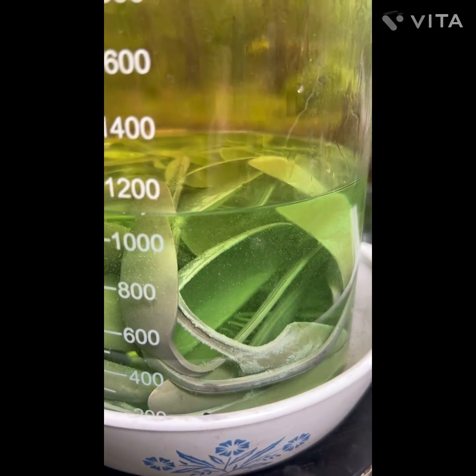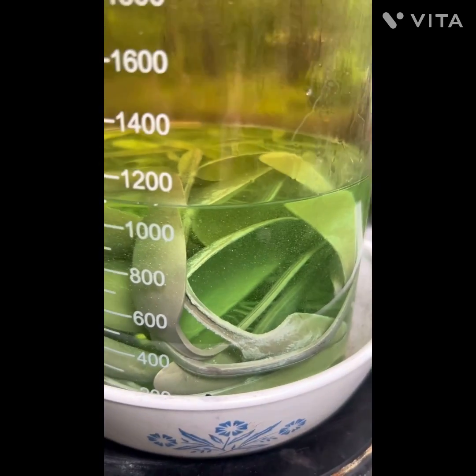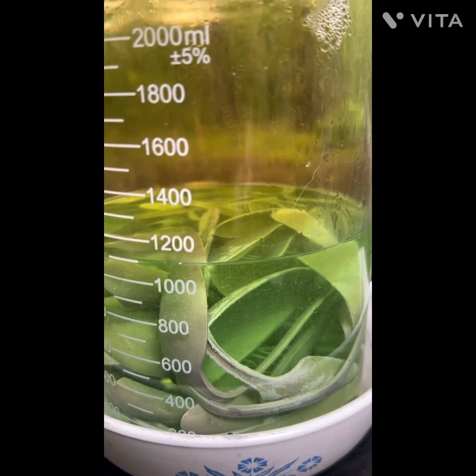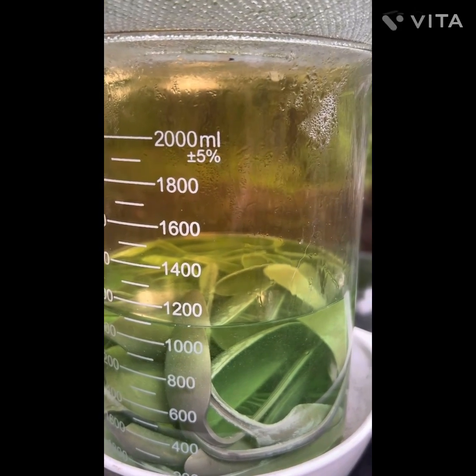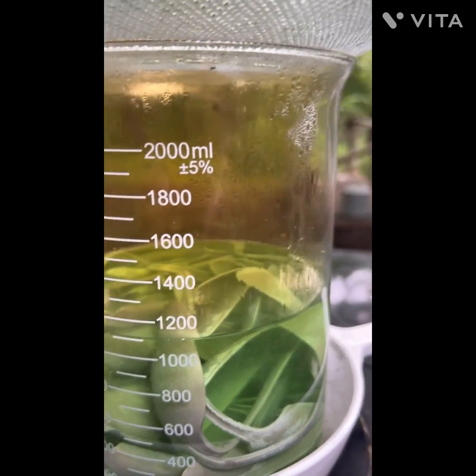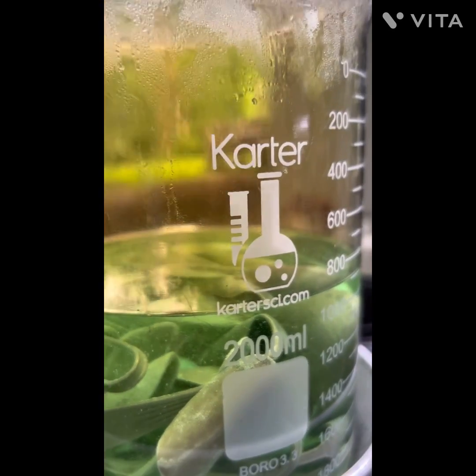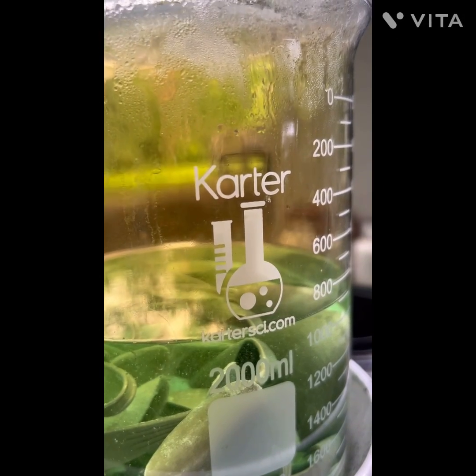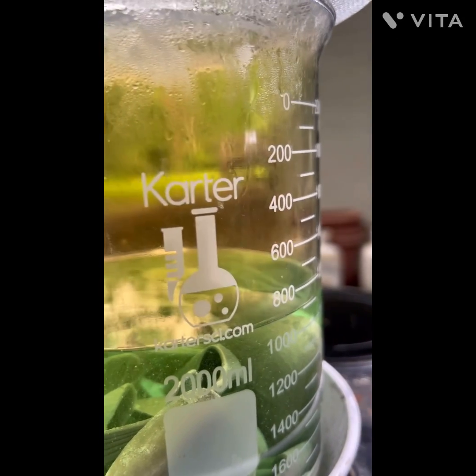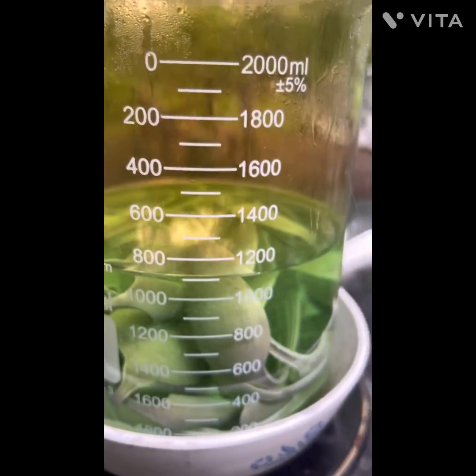You can see where it's starting to go after the silver — see where it's falling off right here? So that's my poor man's stripping solution: sulfuric acid and nitric. We're going to go after the silver and leave the base metals. Hopefully we'll be finished with this today — we'll see, maybe tomorrow — and go after some silver.